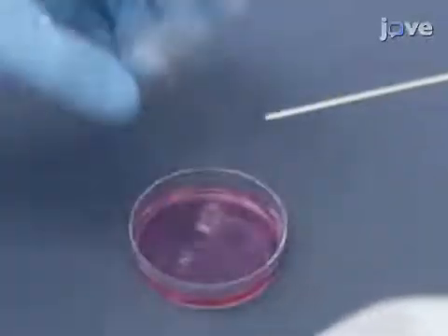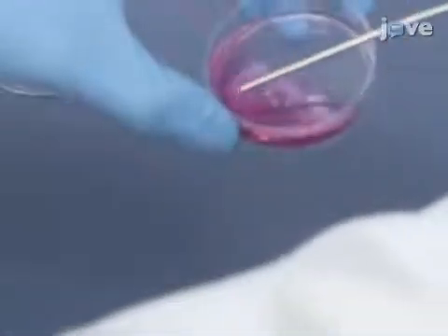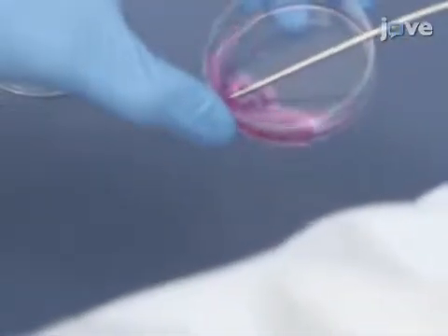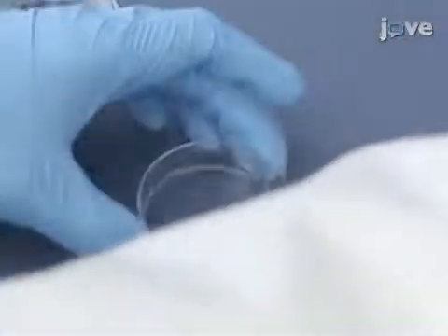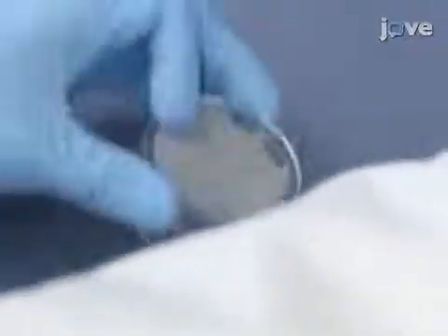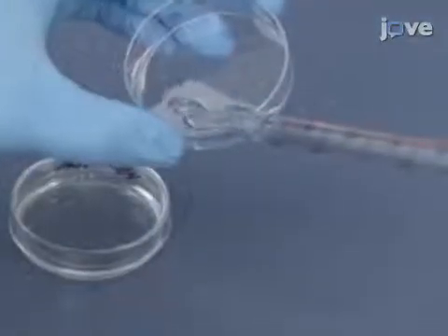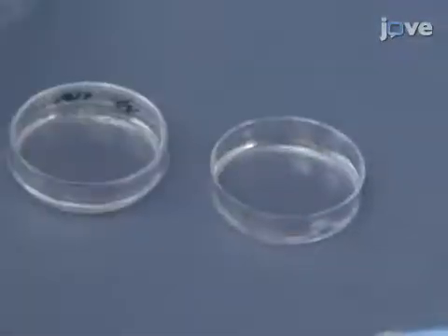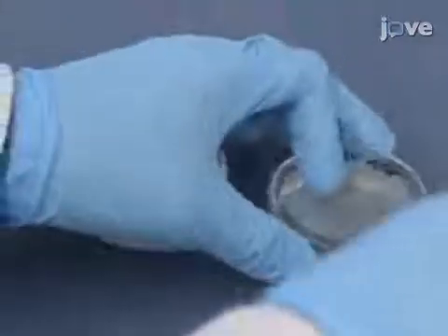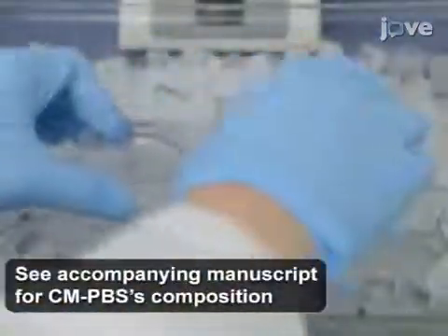To begin this procedure, remove the astrocyte cultures from the incubator and discard the medium by aspiration. Wash the cells thrice with 4 mL of chilled CMPBS and place the dishes on crushed ice.